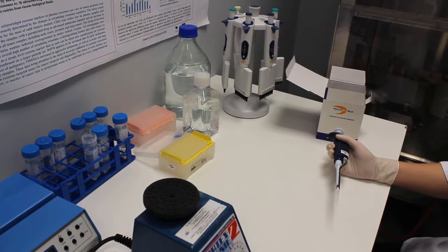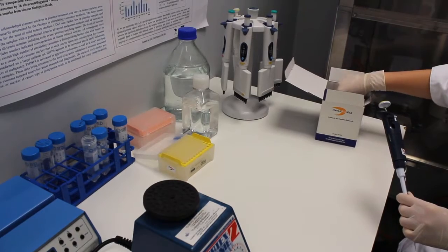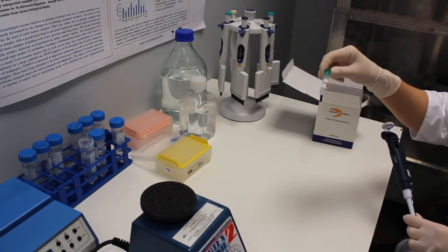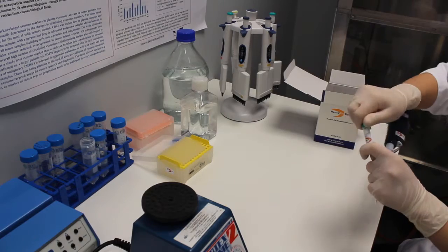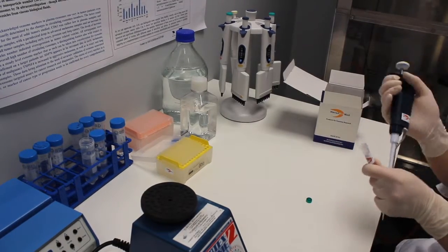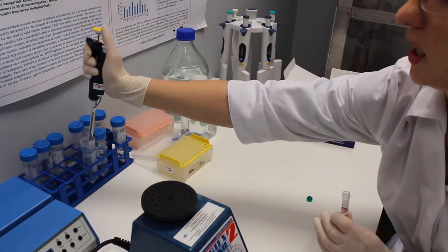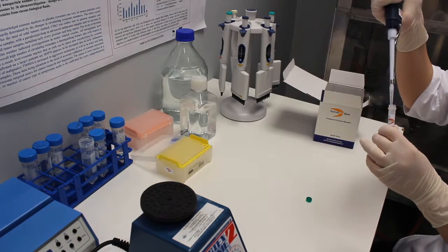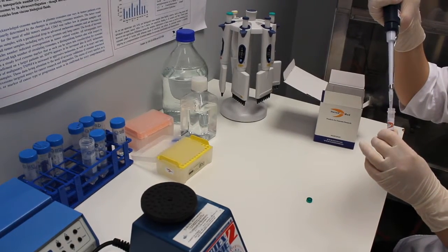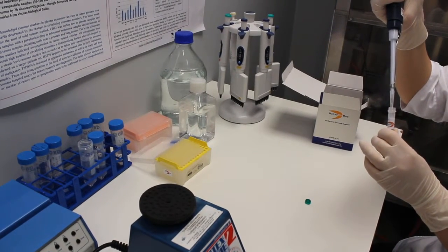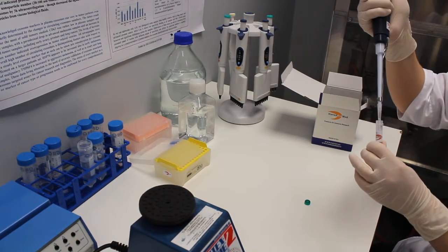Take lyophilized exosomes standards. We take purified exosomes from plasma as we are going to test plasma samples. We reconstitute them adding 100 microliters of deionized water. We suspend well by pipetting, trying to avoid making bubbles.